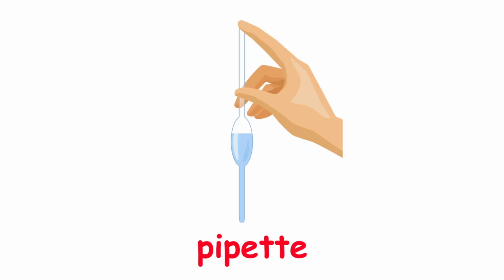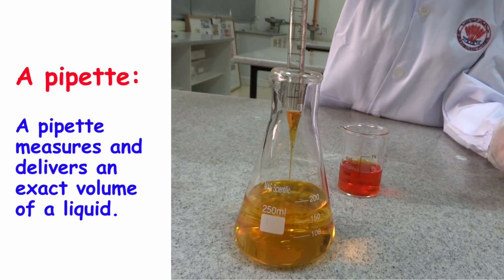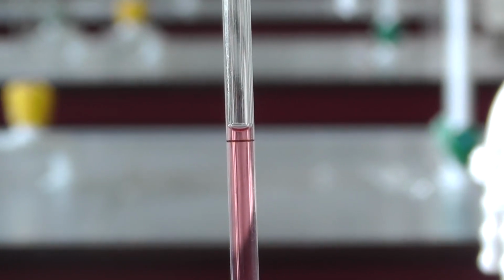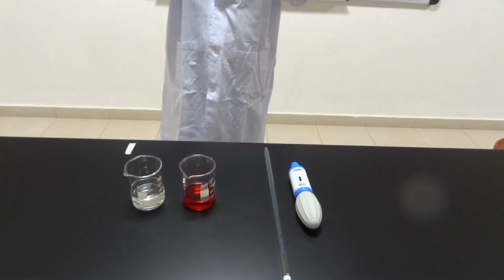A pipette. A pipette measures and delivers an exact volume of liquid. Due to its narrow diameter, the bottom of the meniscus is clearly shown, which makes the volume the most accurate.